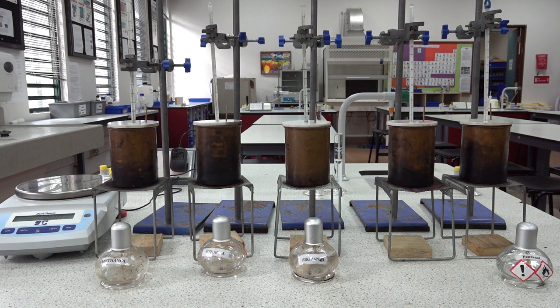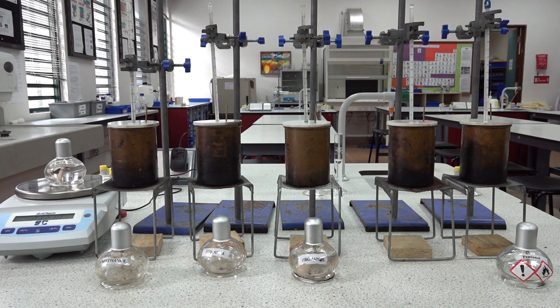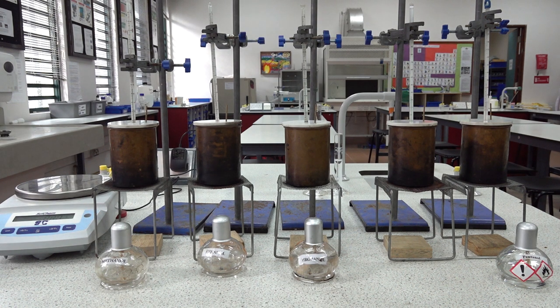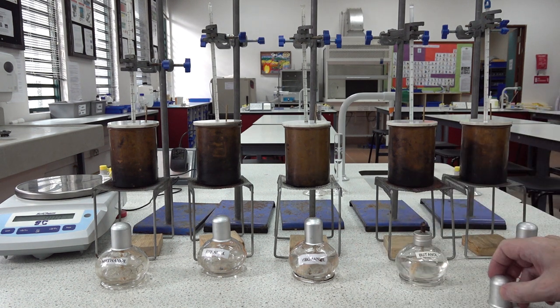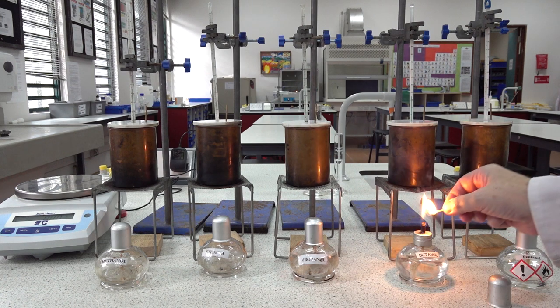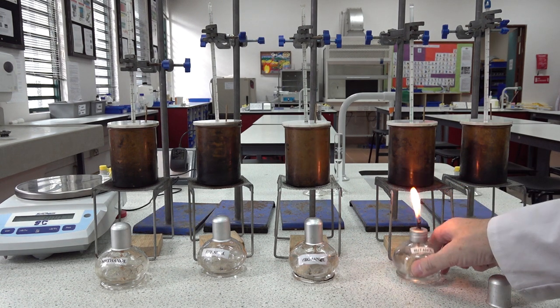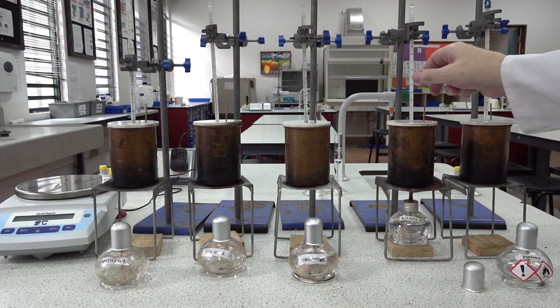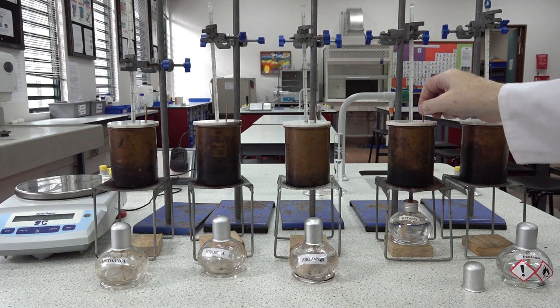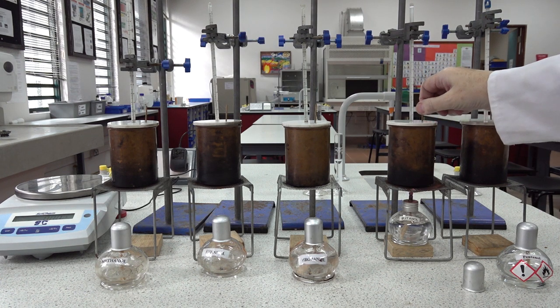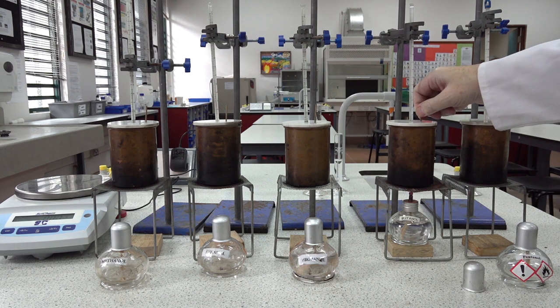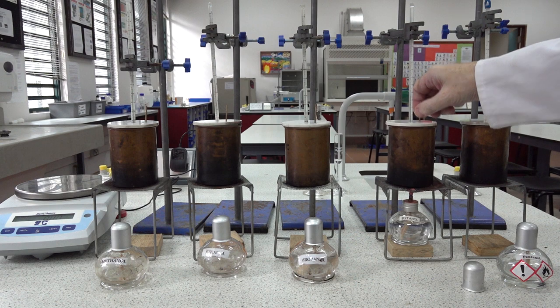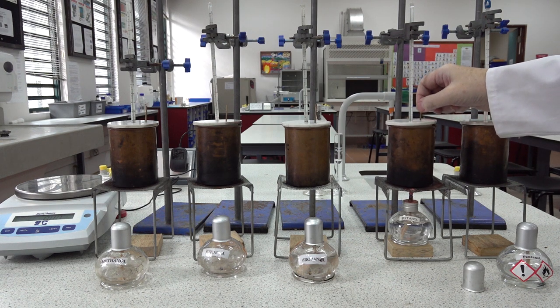On to the next one, the butanol. Mass of the burner at the start: 222.12 grams. Quickly light the spirit burner, place under the calorimeter. The reading at the start: 25. I'm suspicious of the first reading that we got with the ethanol burner, but different thermometers. And once more we heat and stir.